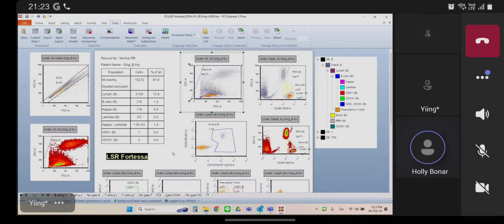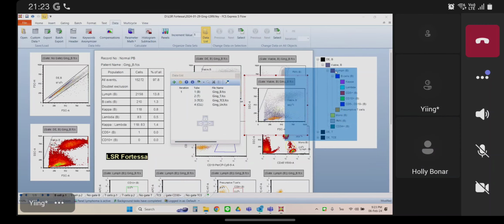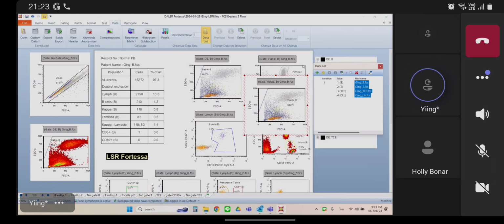And then load a patient that doesn't work. So go to your data list. Yep, delete these. I will show you.